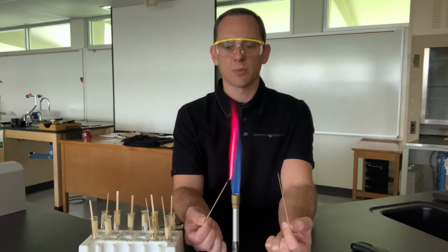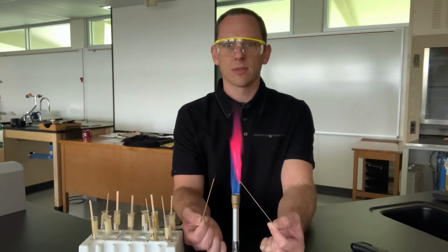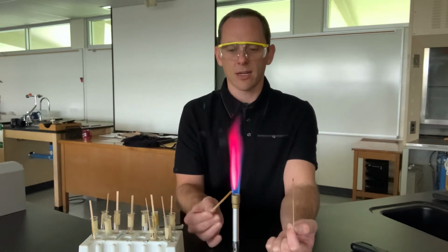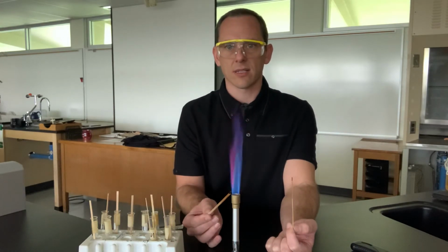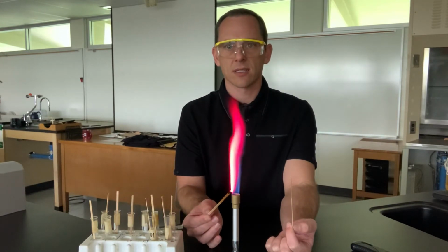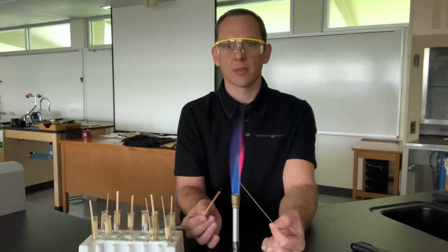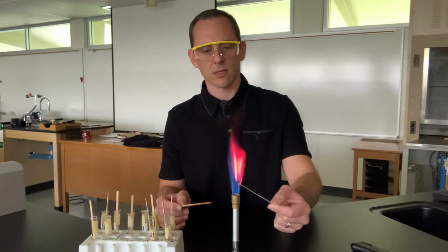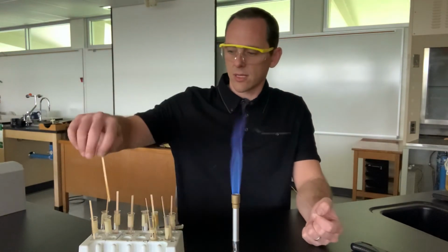This one is much more purple. This one is more on the red side. It's not as much purple in it. It's not showing up great. Let's see, there it is. It's nice. The iPad's having a little bit of trouble with it. Okay. This one was the lithium.